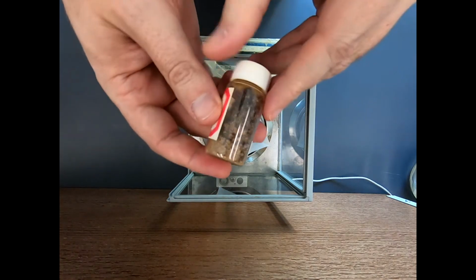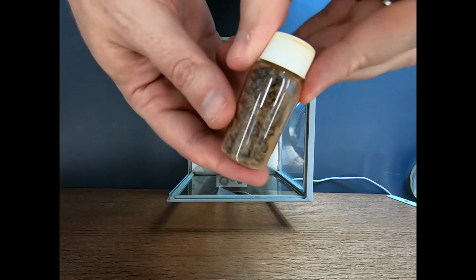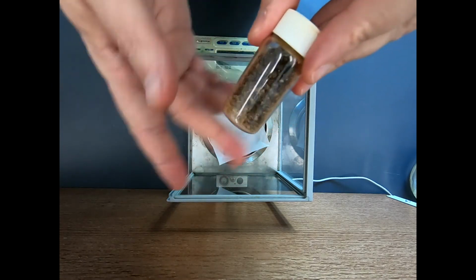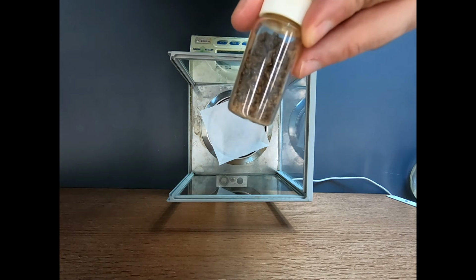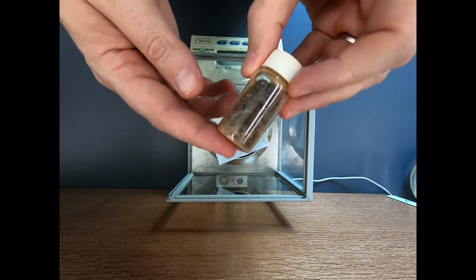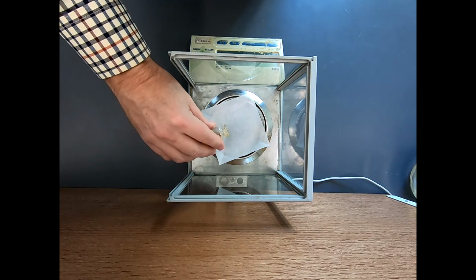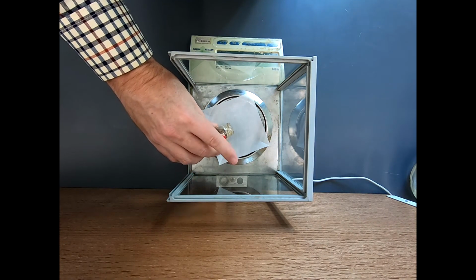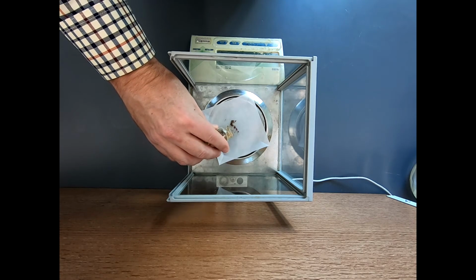Now, para-toluidine is an aniline, and anilines tend to pick up a lot of brown color. And you might say, yuck, that looks terrible. Well, actually, it takes very little colored impurity to impart a lot of color. So even though this doesn't look very pretty, it'll be just fine for our reaction. So I need about 577 milligrams. This is going to take a little bit of delicacy because there's some big chunks in this bottle.